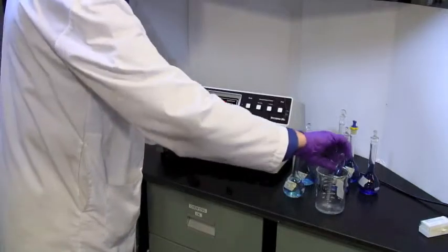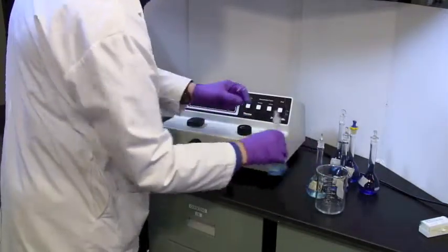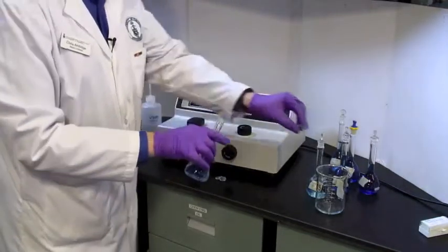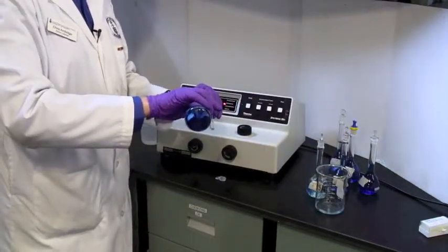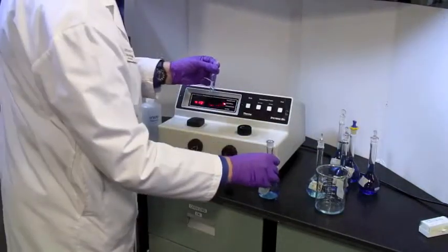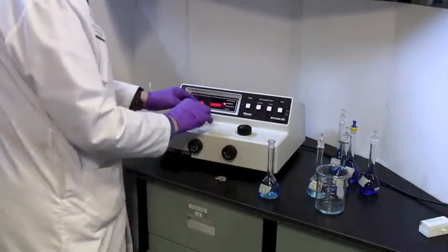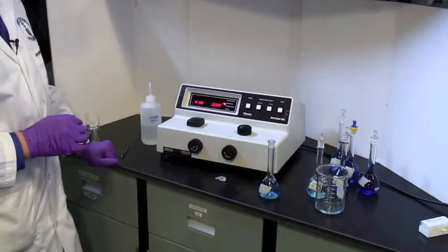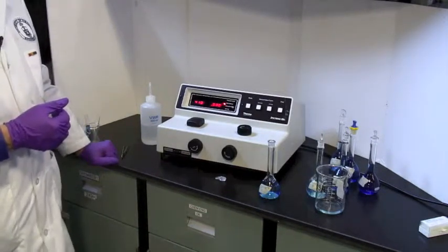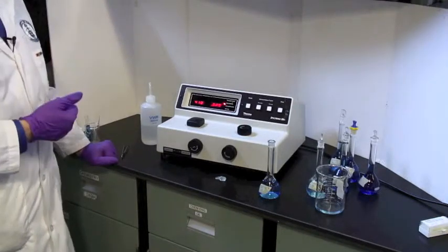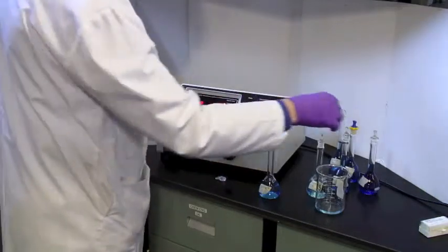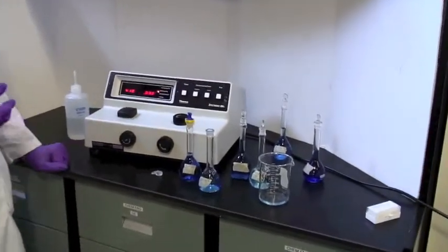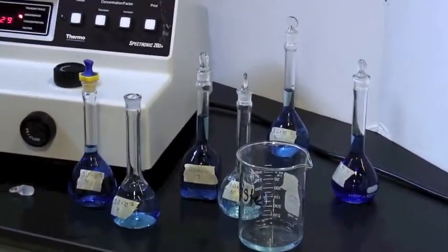Moving along, we dump that and take the next solution, and again rinse it with the actual measurement solution. You've got quite a lot of it, and pop it in, align it, and read again. And 2 times 10 to the minus fifth molar is a reading of 0.030. So these solutions will all increase. We can keep on reading for all of these darker colored solutions, and then draw the calibration curve.